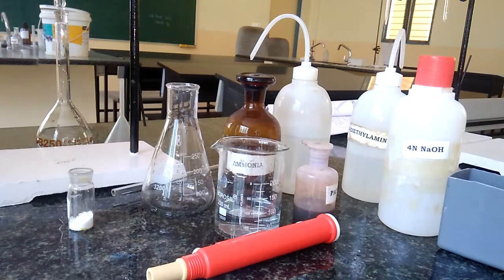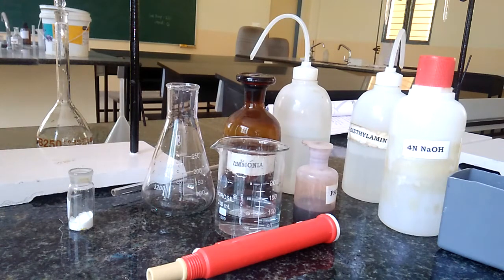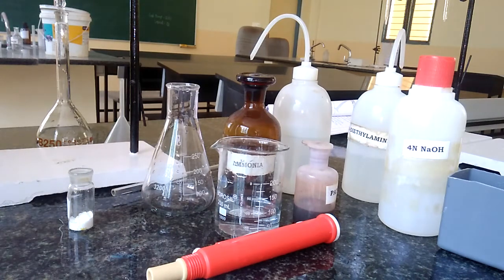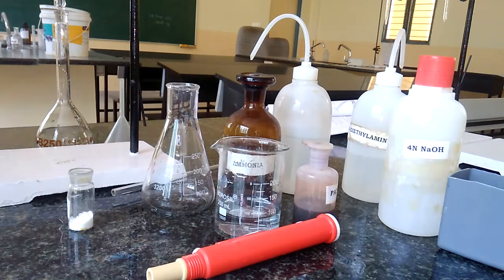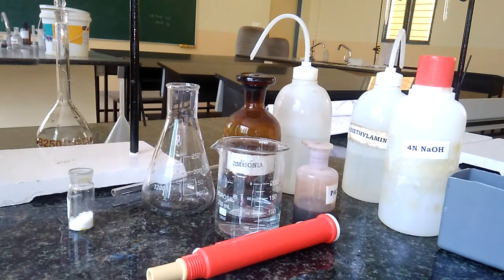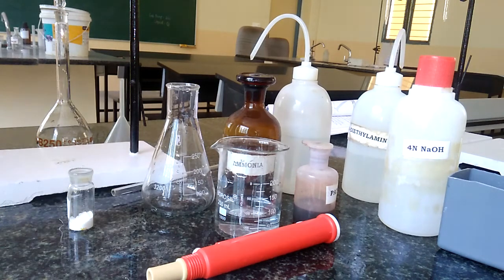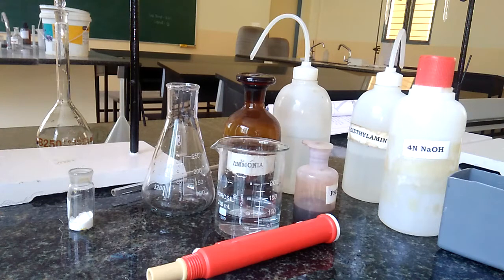Before giving the demonstration of the first step — preparation of disodium salt of EDTA — I would like to give some important hints about cement solution. Cement solution contains various oxides of metals such as calcium oxide, magnesium oxide, silicon dioxide, iron oxide, etc. But majorly it contains calcium oxide, and that percentage we have to estimate by doing this complexometric titration against the disodium salt of EDTA. Disodium salt of EDTA is preferred as a standard solution because it is a very good complexing agent which makes a complex with the metal ions present in the cement solution, and that can be easily estimated.